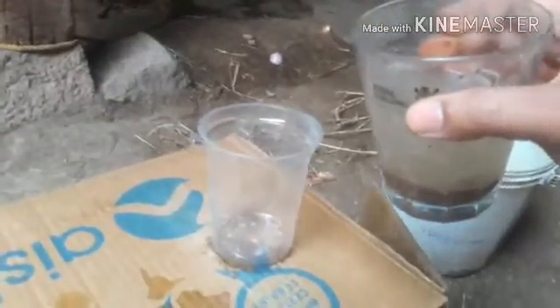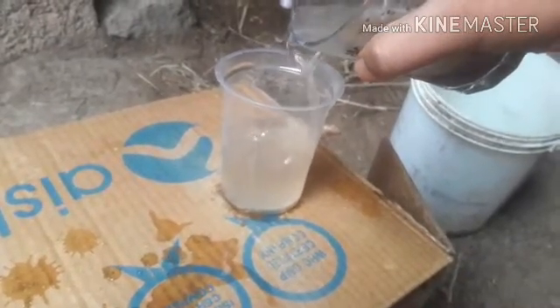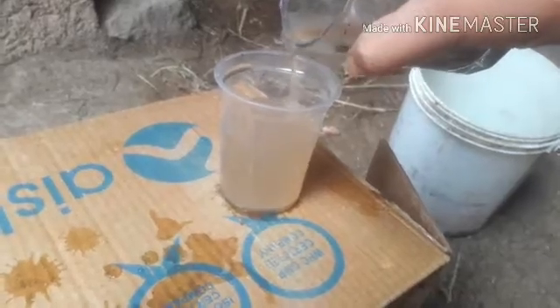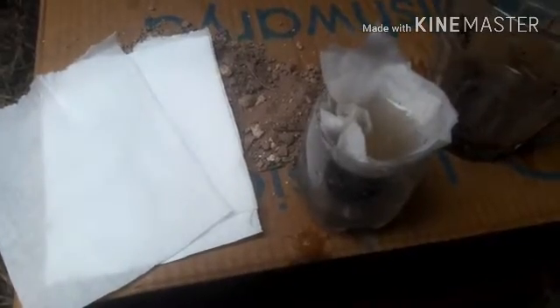So without disturbing the lower layer, I am going to pour the upper water, right? Okay, now this is the solid that we get separated. Have you seen this? So this is the decantation process where we got the water, but the impurities can be removed by filtration. We can remove them by filtration, right? See how it is getting filtered. Whatever impurities are there, they are filtered by the filter paper. Are you able to see this? How the pure water is getting down.